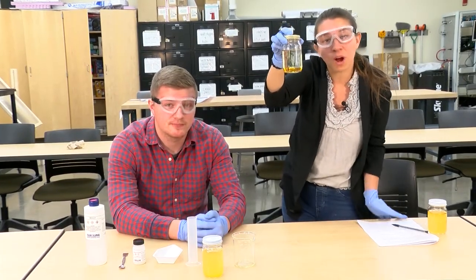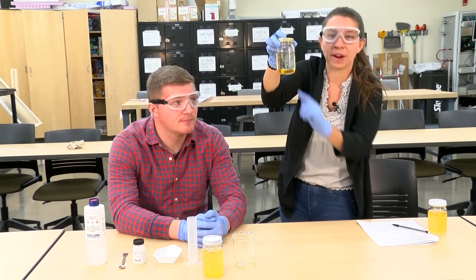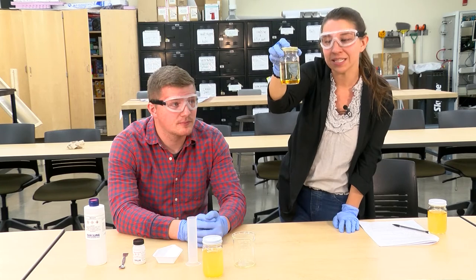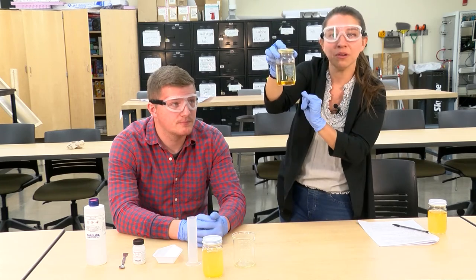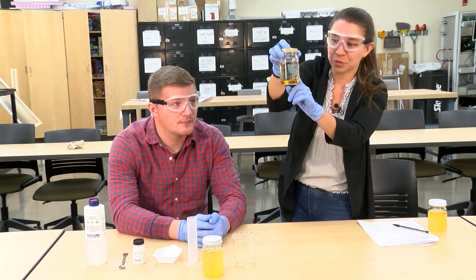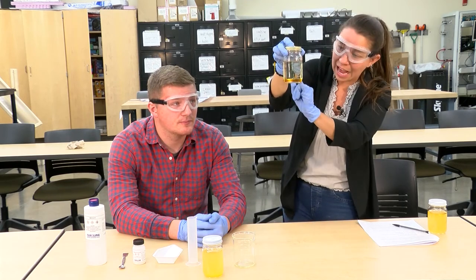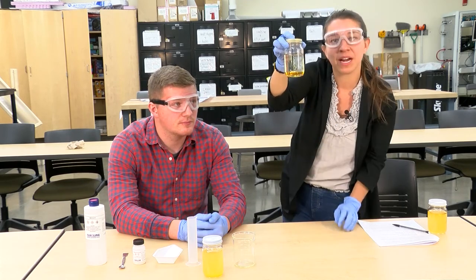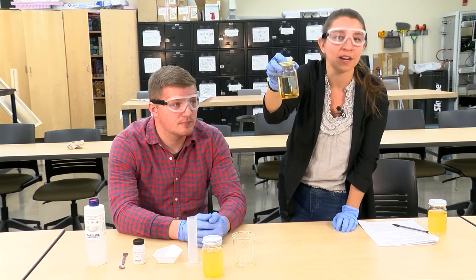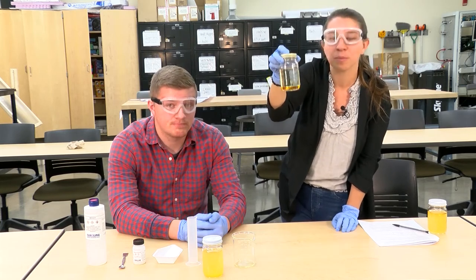When we go to process this biodiesel, this part right here — these methyl esters — is what we use to make diesel. This will get filtered out, and we'll see in step three some things we can do to clean it up. The glycerol will be tapped out of the bottom and used in the manufacturing of cosmetics, soaps, and a whole other range of products.